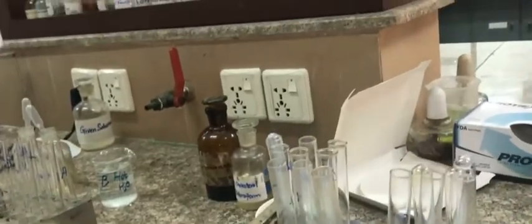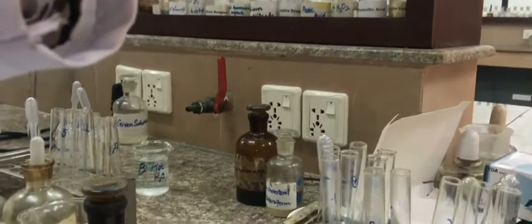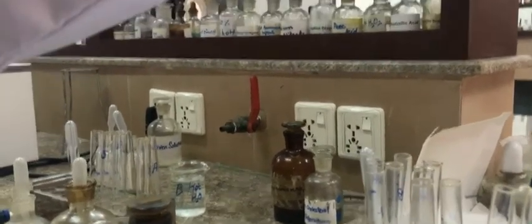In test tube B, after adding 3 drops of calcium chloride, we see precipitates of calcium salts formed. In test tube C, after adding 3 drops of magnesium chloride, we see precipitates formed of magnesium salts. In test tube D, after adding 3 ml of concentrated HCl, we will see precipitates of liberated free fatty acids obtained.